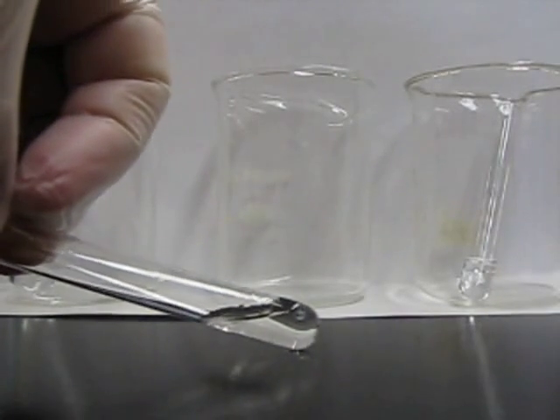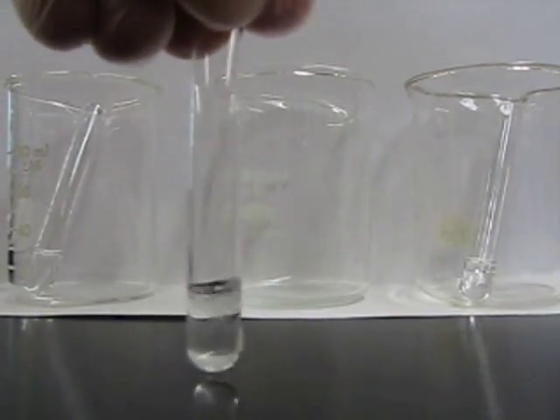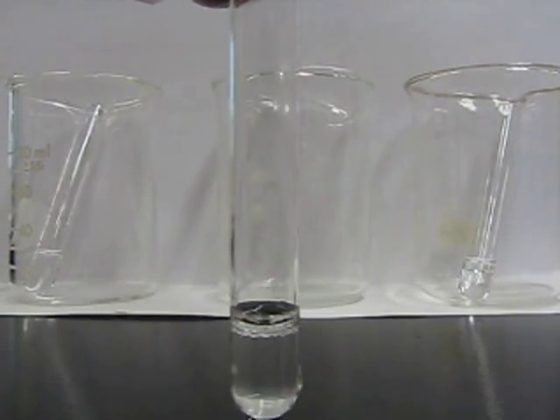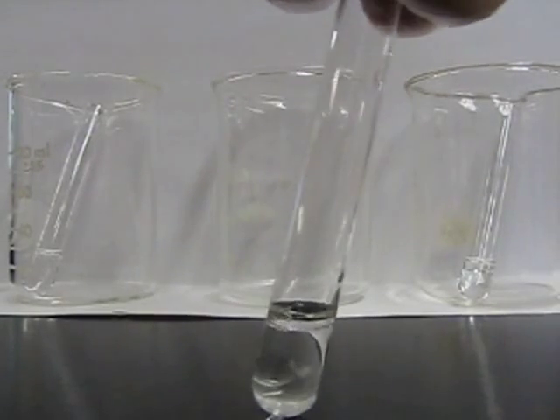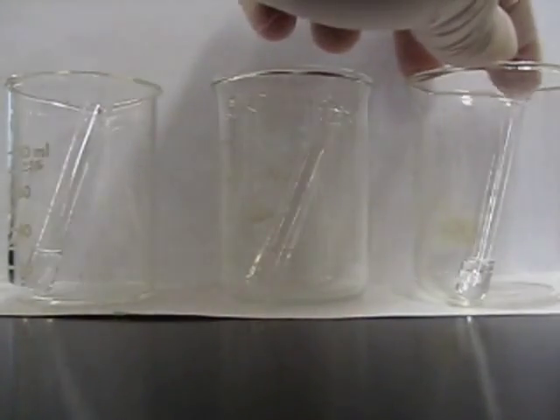The second one, if it wasn't too clear initially, you can try tilting it, shaking it a little bit, and seeing what happens. You can see in this case that there's definitely a small organic phase on top of the hydroxide we added. So that'll be one of the butanols.